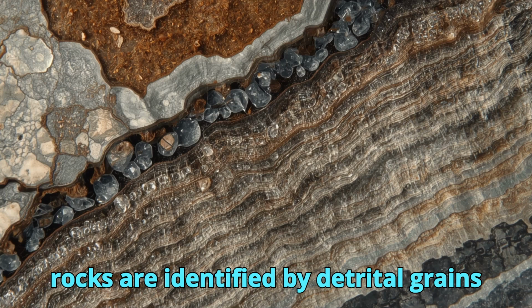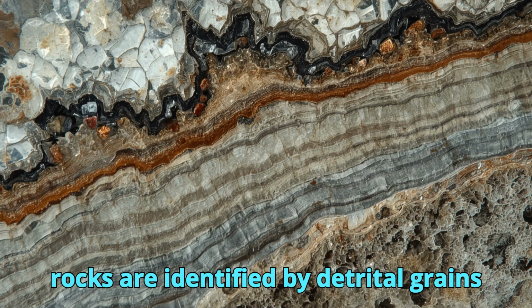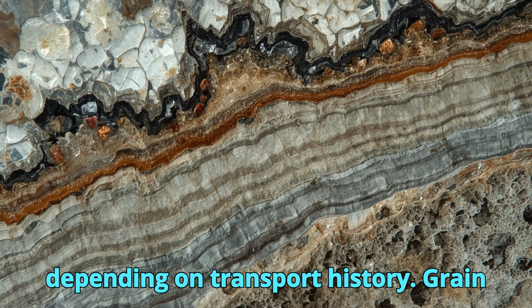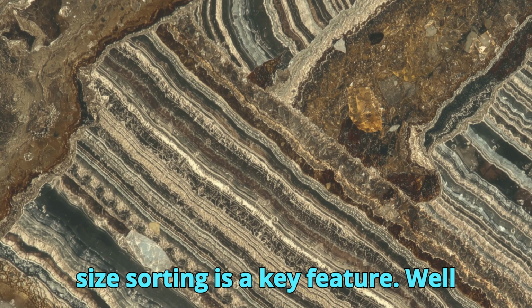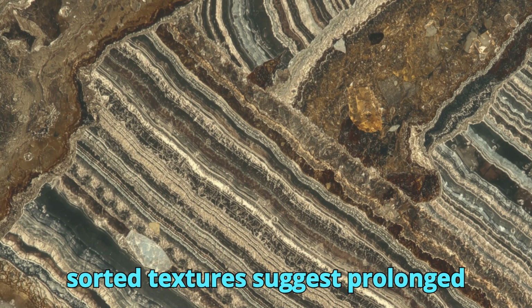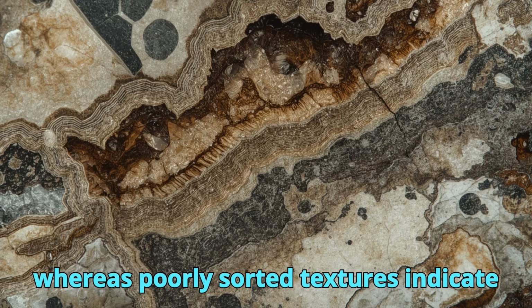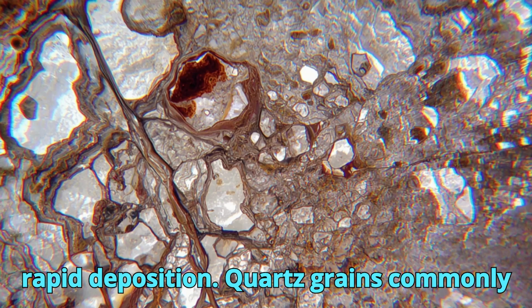Sedimentary rocks display textures that reflect processes of weathering, transport, deposition, and lithification. Under the microscope, clastic sedimentary rocks are identified by detrital grains that are often rounded or angular depending on transport history. Grain size sorting is a key feature. Well-sorted textures suggest prolonged transport or uniform energy conditions, whereas poorly sorted textures indicate rapid deposition.